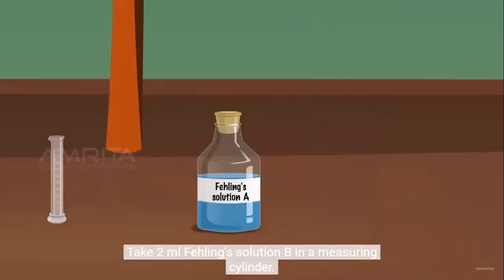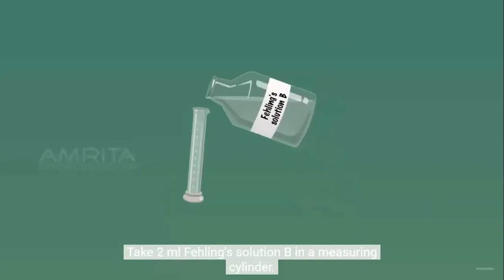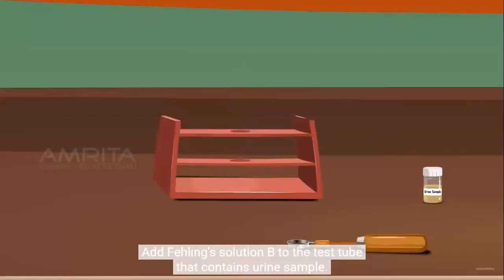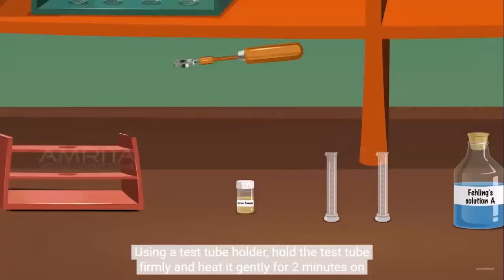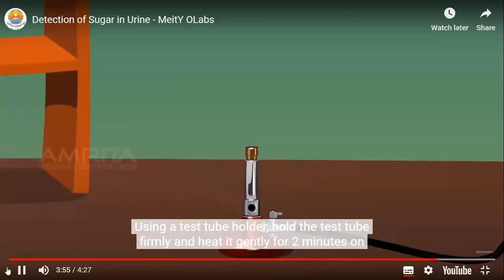Take 2 ml Fehling's solution B in a measuring cylinder. Add Fehling's solution B to the test tube. Using a test tube holder, hold the test tube firmly and heat it gently for 2 minutes on the burner.